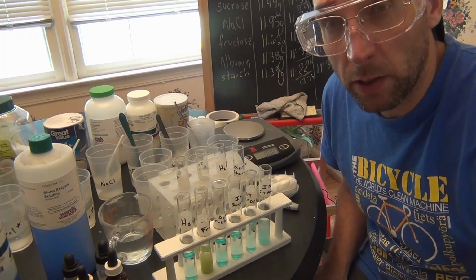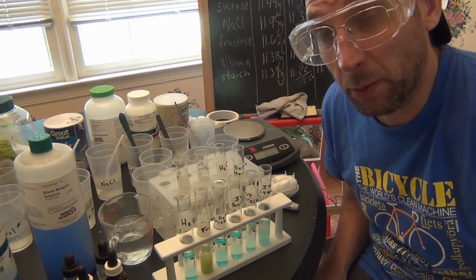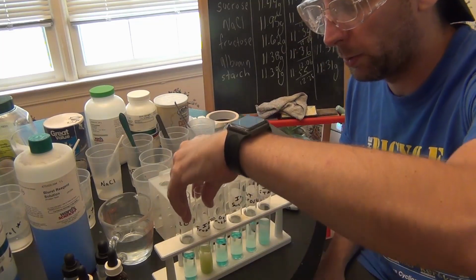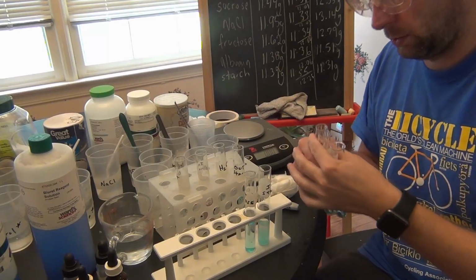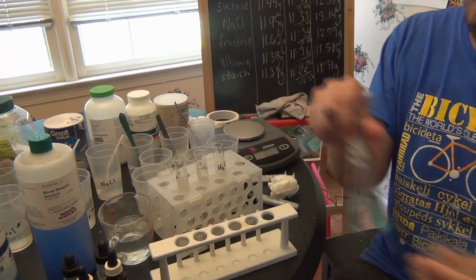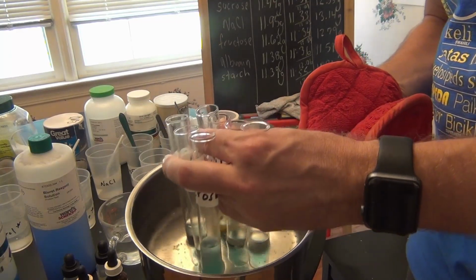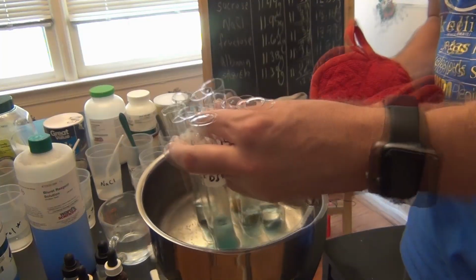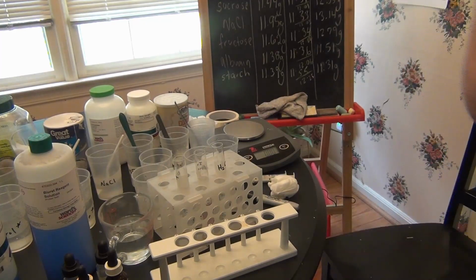Okay, my water's heated up and I was about to put them into the water, but before I do that, I want you to notice that there's already been some color change with a little bit of time. So I'm going to take these all to the pots, put them in for a couple minutes, and then you will see what they look like. Hopefully I don't spill any. Actually, I can kind of show you what's going on. So I just have them in the hot water, and I'm going to let them sit in there for a couple minutes. Actually, I'm going to go rest them on the stove.